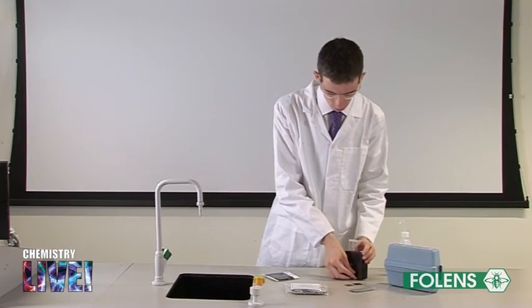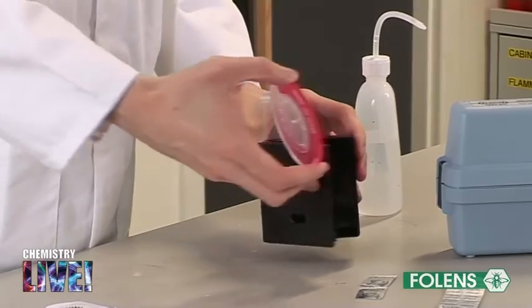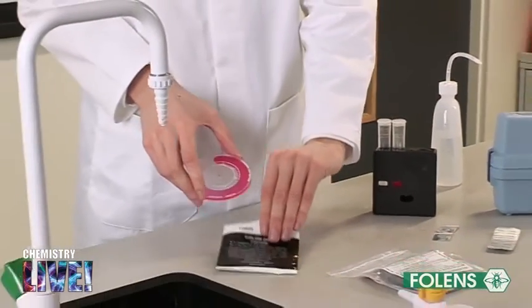When finished, return the colour disc to its envelope. This envelope helps to protect the colours on the disc from fading.